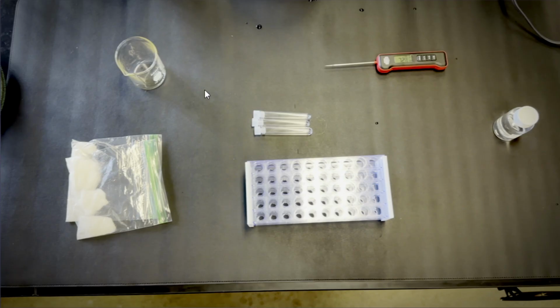And then, more importantly, you're going to have to supply ice. So you're going to need a little bit of ice. If you don't have ice, make sure that you stop this and then go find ice to begin with. We also have a thermometer. You should have a thermometer with your kit, but if you don't, make sure that you can find it or find a way to measure the temperature.